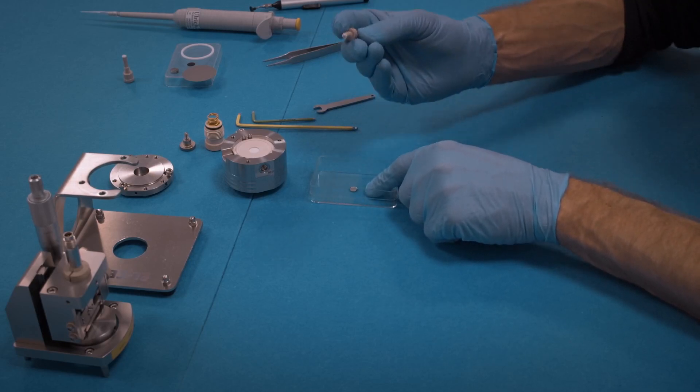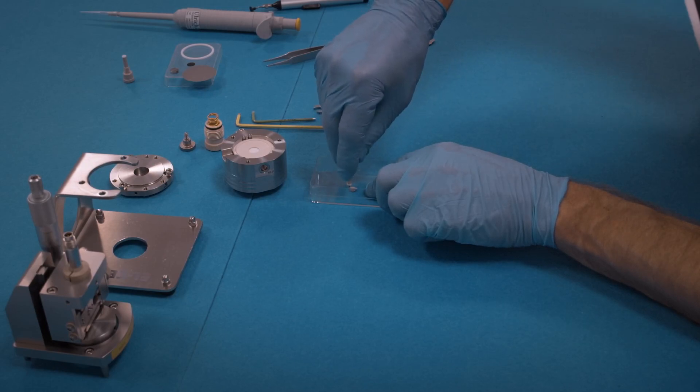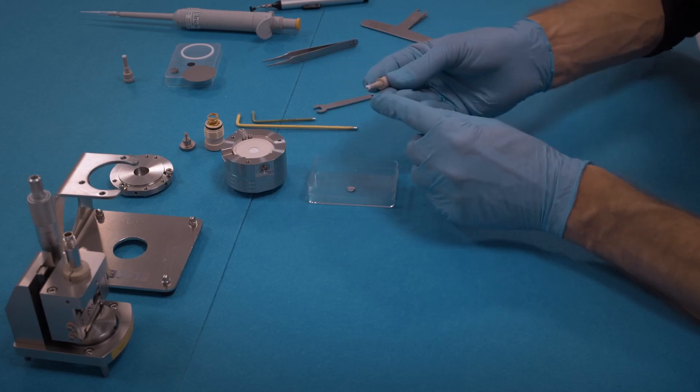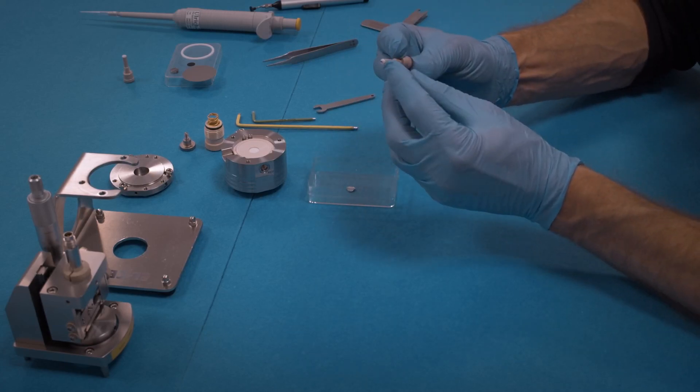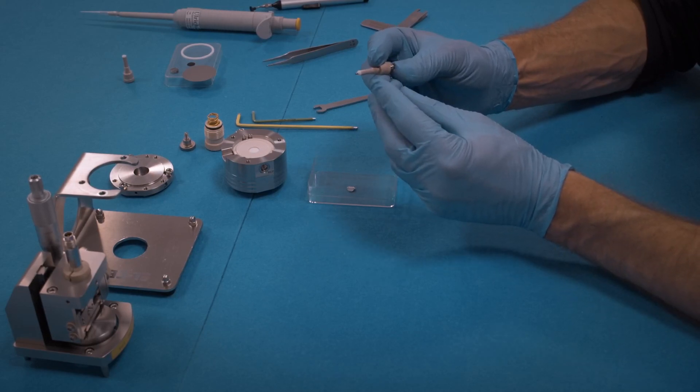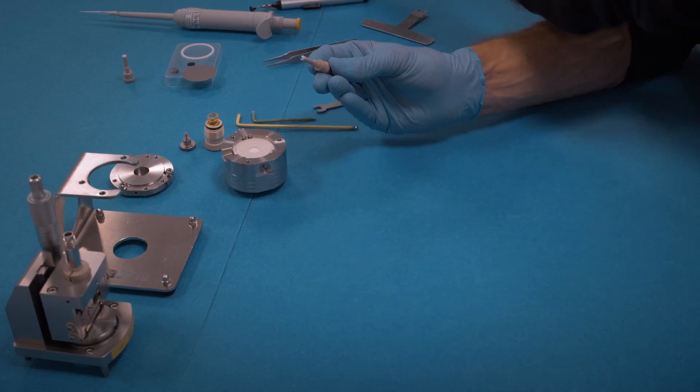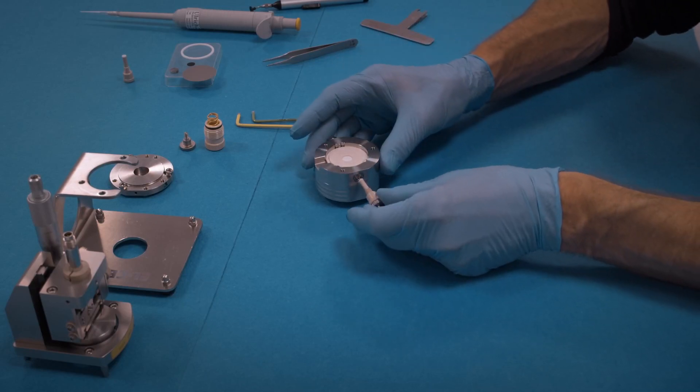Pick up lithium metal and put the lithium metal on a polyethylene foil or similar plastic foil. Press the reference pin onto the foil. While doing so, you have to press on the button of the reference assembly to prevent the PTFE ferrule from getting in contact with lithium metal, which has to be prevented.